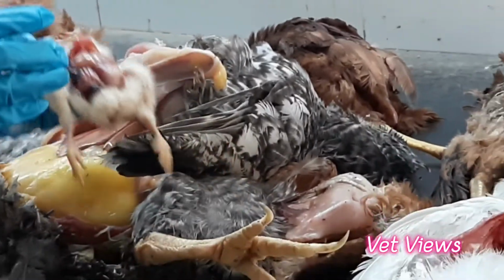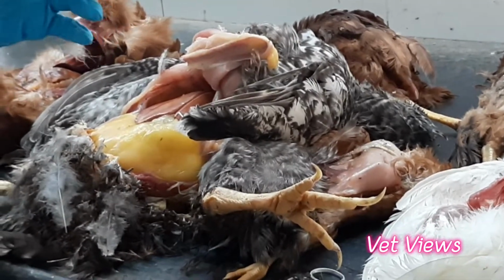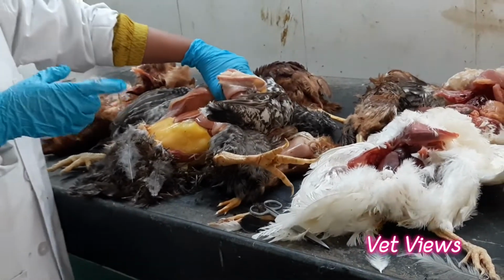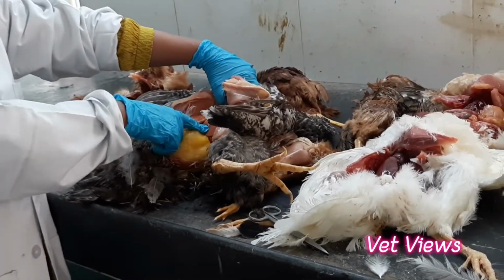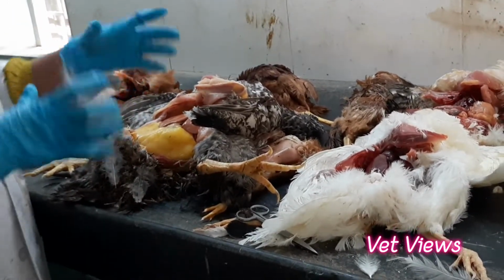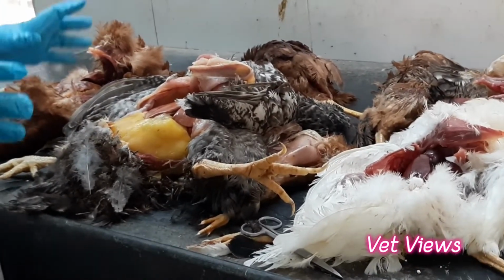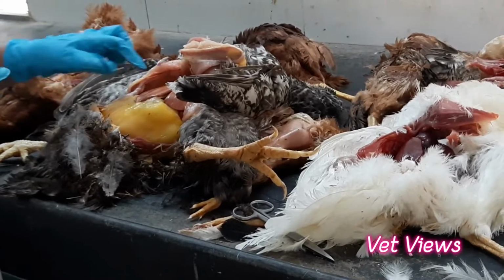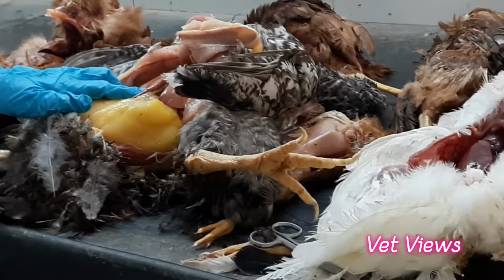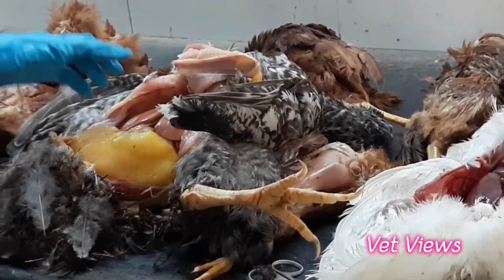So one more change is tumors, especially you might have seen the slides, like tumor focus. Today we don't have the cases, but usually we get the tumor lesions over the liver. It will be like white nodules, and the liver will also look too big. When you open it, it will become very big. Sometimes you will get discrete nodules, sometimes very small, tiny, diffused nodules will be there. So that is an indication for Marek's disease or avian leukosis or reticuloendotheliosis. These three are the major tumor diseases which affect the liver mainly, and internal organs also.